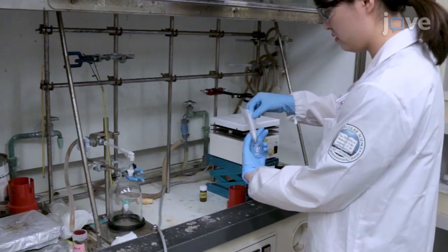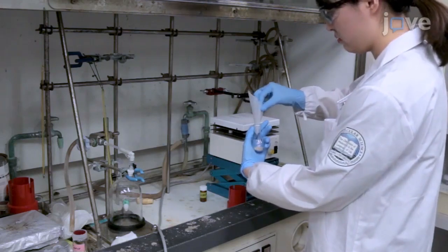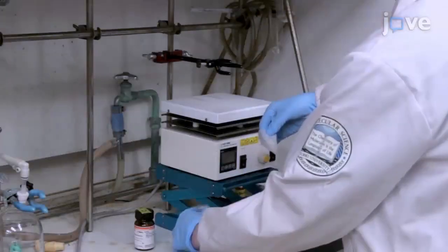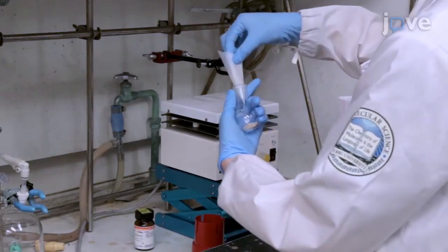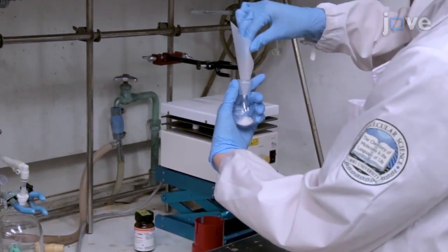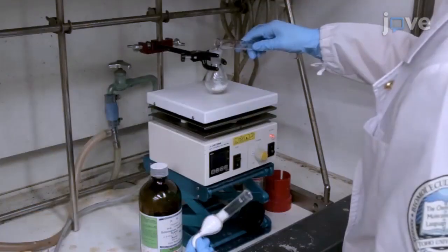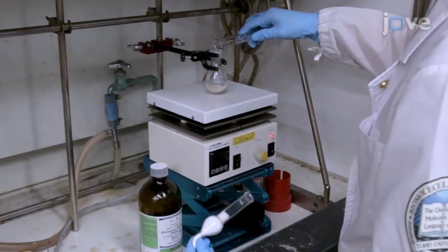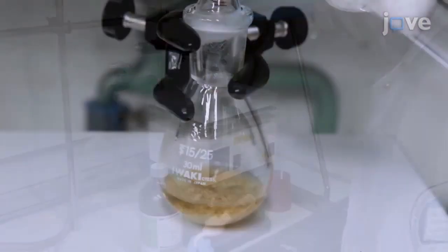Begin by adding 709.6 mg of PABHC methanol and 397.6 mg of NN-carbonyl diimidazole into a 30 ml round-bottomed flask. Add dry 6 ml of dichloromethane to the flask and stir the solution at ambient temperature for 1 hour.